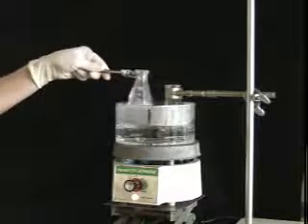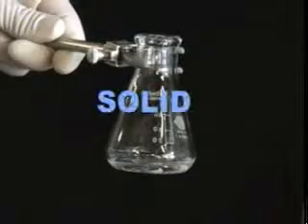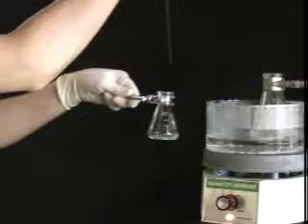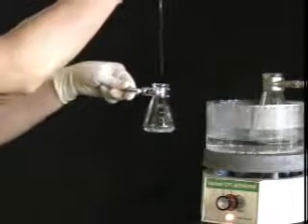Remember to add a few boiling stones to the solution and boil until solid begins to form. At this point, add a small amount of hot solvent to redissolve the solid. When your sample is once again dissolved in the minimum amount of solvent, set it aside to cool.